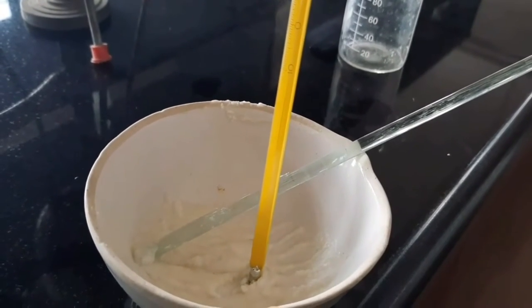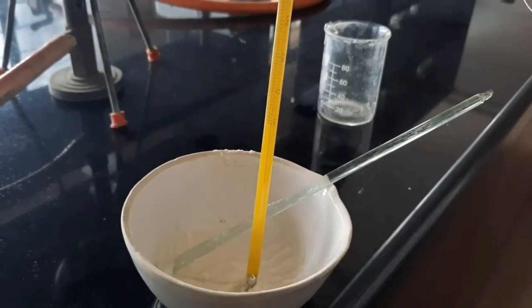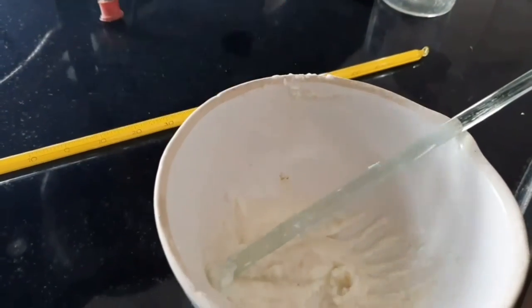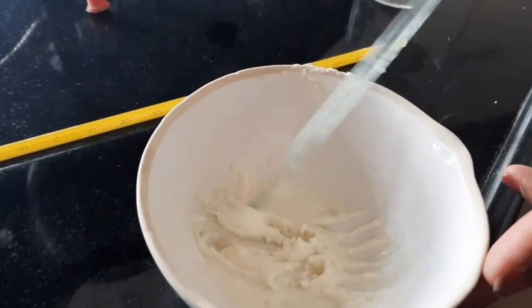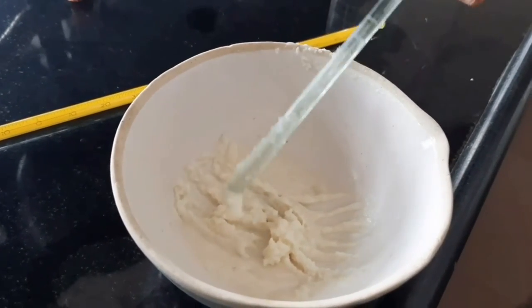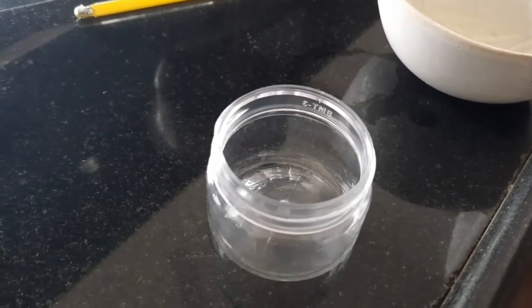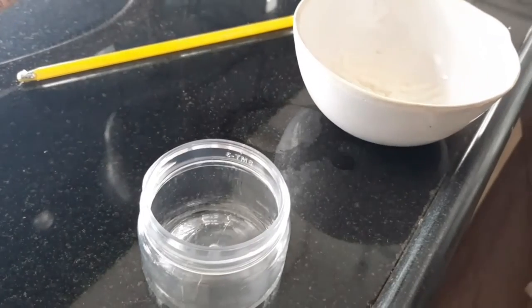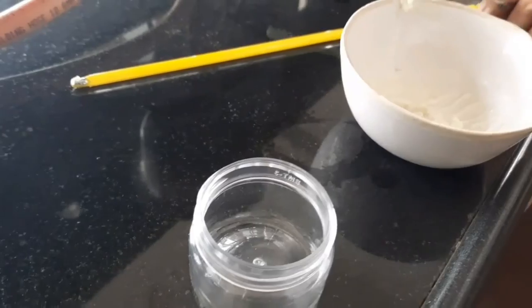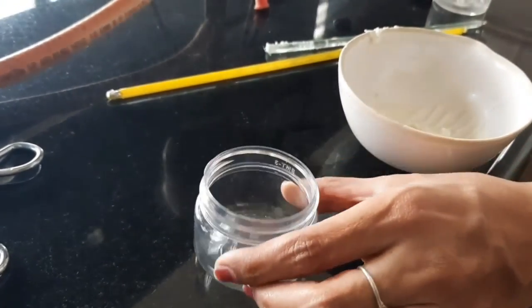We will check the temperature — it should be 45°C for the formulation. The cream is now ready; this is our herbal cream. We will now perform the evaluation test. For herbal cream, we require a wide mouth container, and we will fill our cream into it.